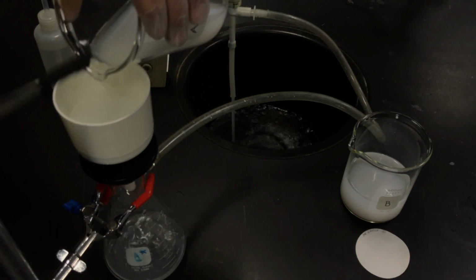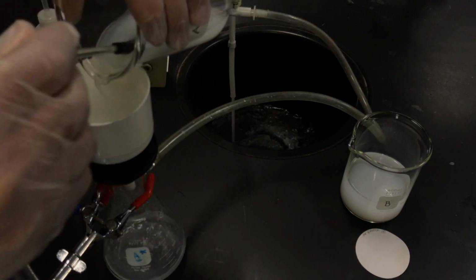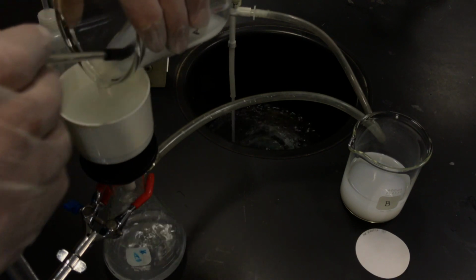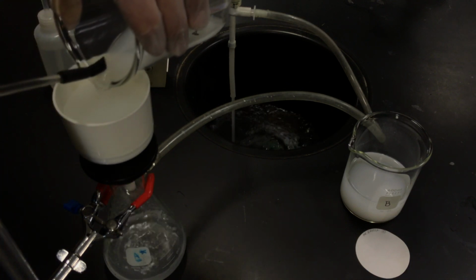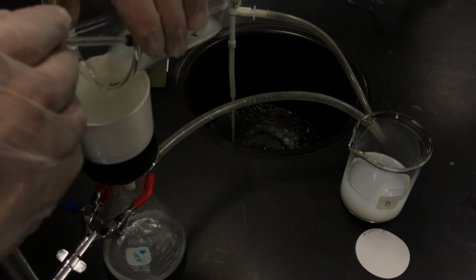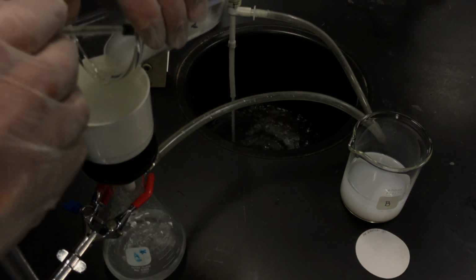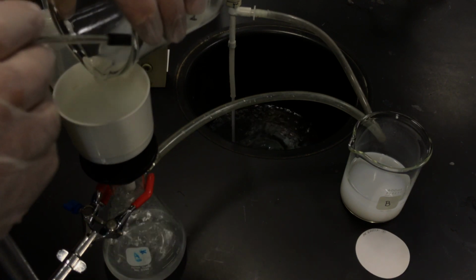I will try to get all the precipitates. Again, it's really good to try to push the solids with the water or the rest of the solution. I know I have calcium chloride, and of course you should recognize the fact that I've got either potassium, lithium, or sodium ions and chloride ions that are spectating here.